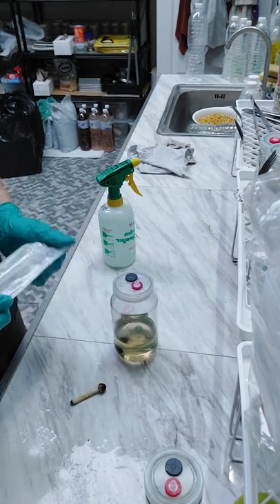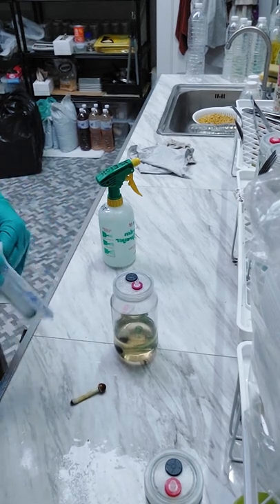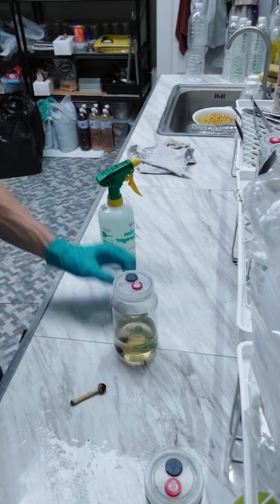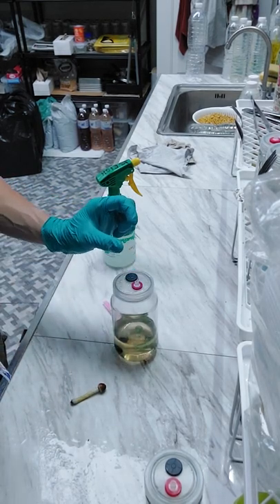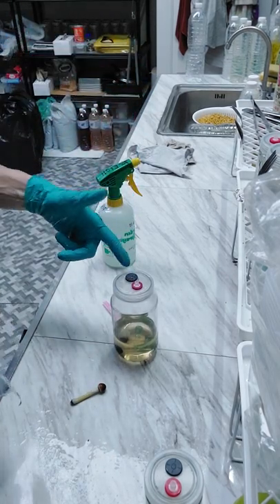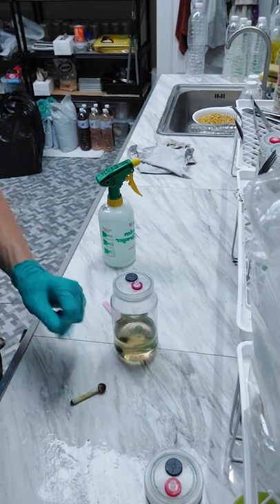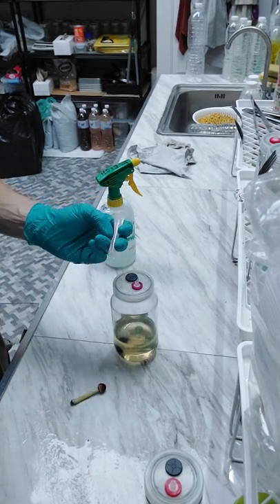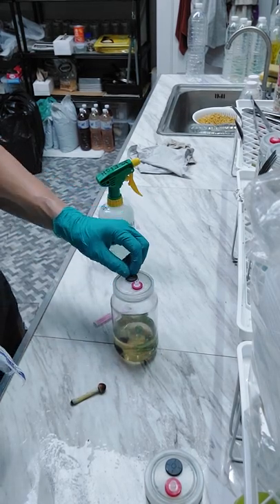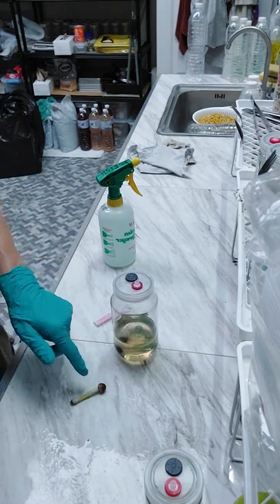And this is where you're going to hold your breath. I'm going to open the syringe and then I'm going to tilt this. I'm going to suck up a little bit of LC and clear the needle so there's actually air in the needle, but I'm going to do that inside of the LC jar so it remains sterile. The reason I do that is because I'm not going to be able to get a piece of the mushroom flesh into the needle if it's got liquid in it. So you want to remember to clear the needle before you take it out of the LC jar and before you jab it into your mushroom flesh.